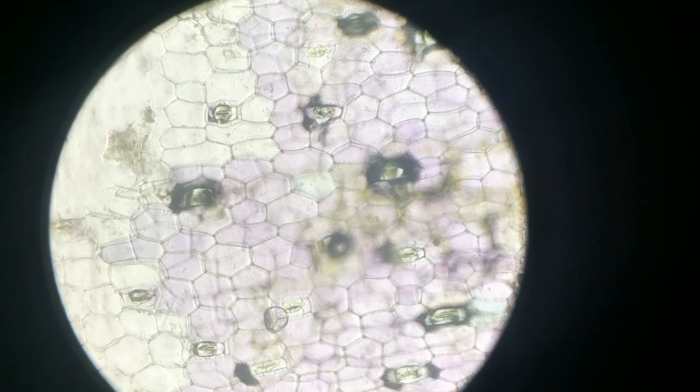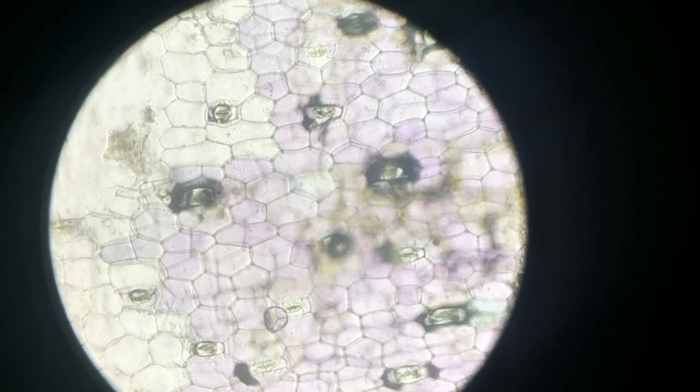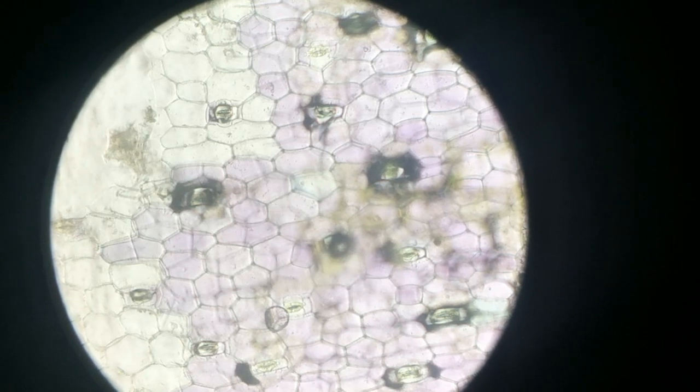So can you see any nuclei present? No, right? The reason is they are not visible at this level of magnification, but you can see the cell wall, the boundary, very clearly. So we are going to draw such a picture in the space given in the tutorial. That is the way you observe. You can observe this and draw a picture of it. I mean, not an art drawing, we are drawing a pencil diagram.